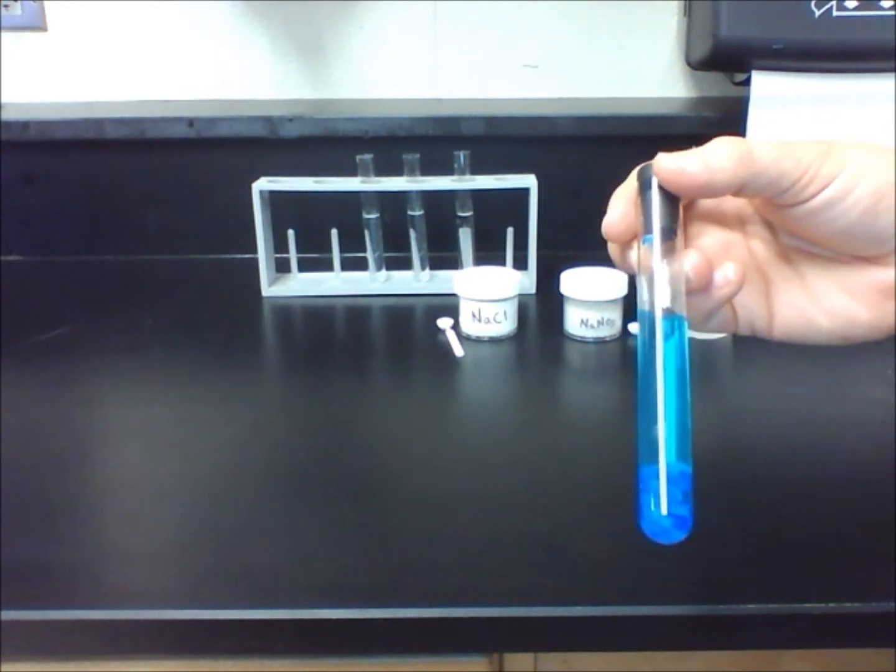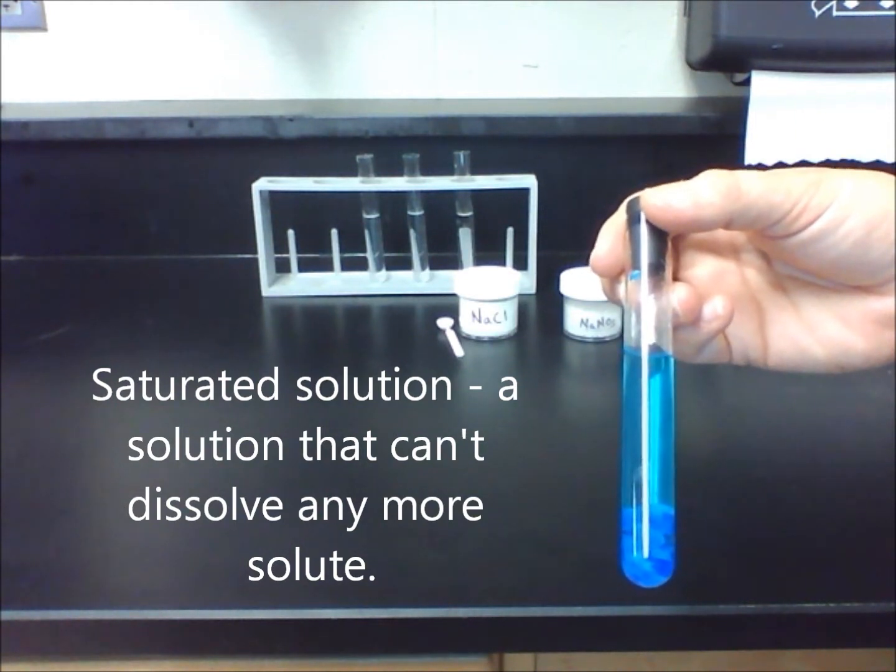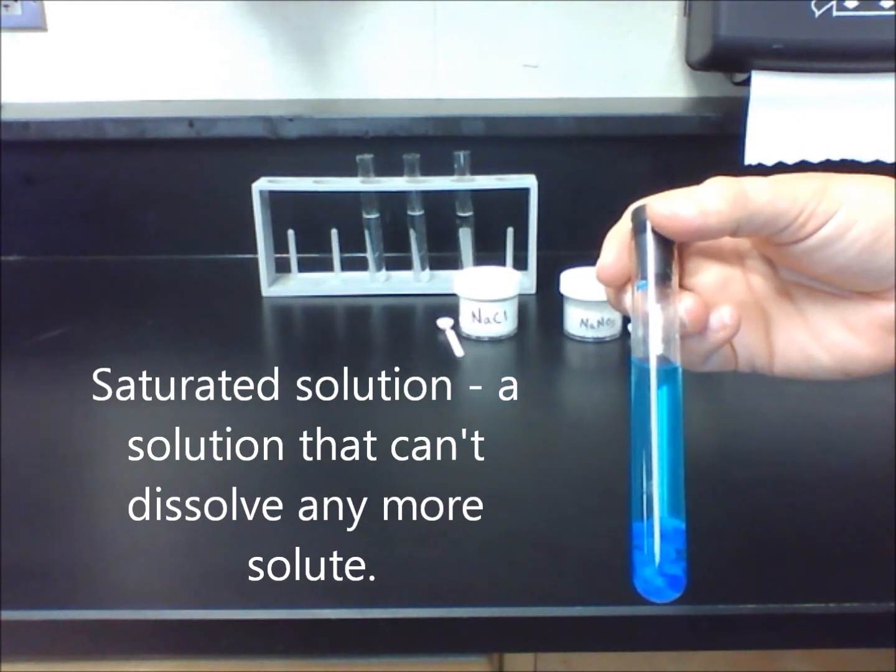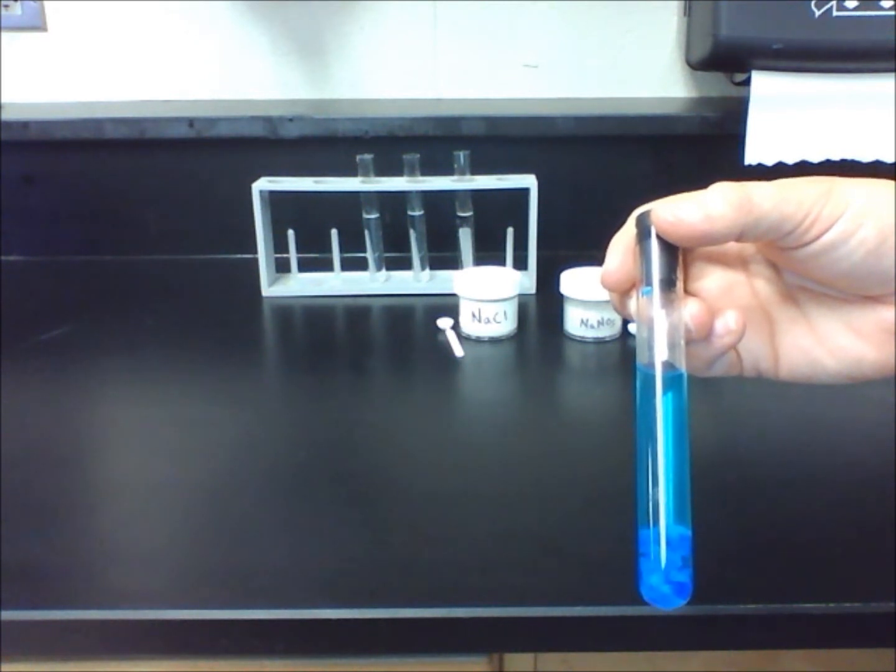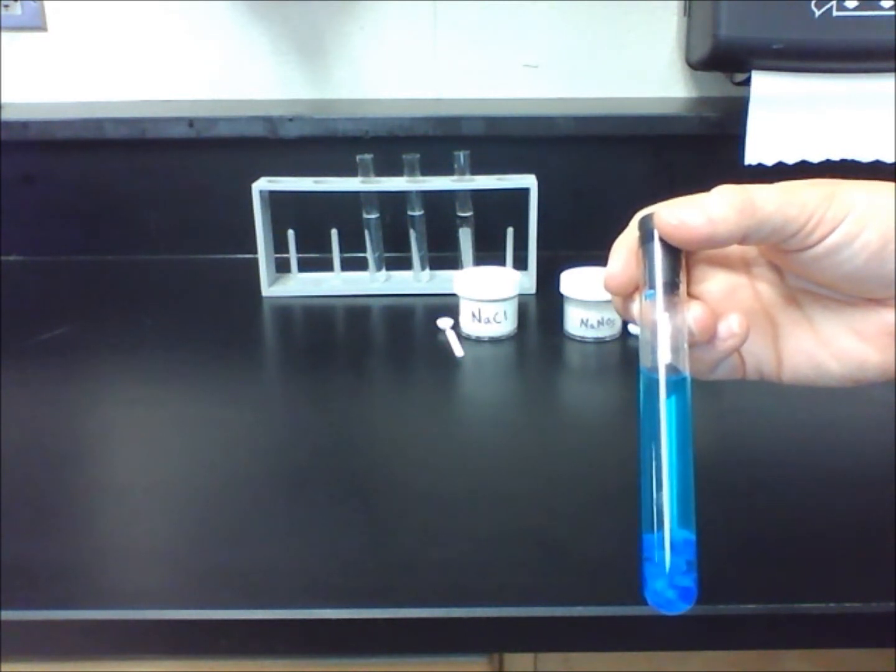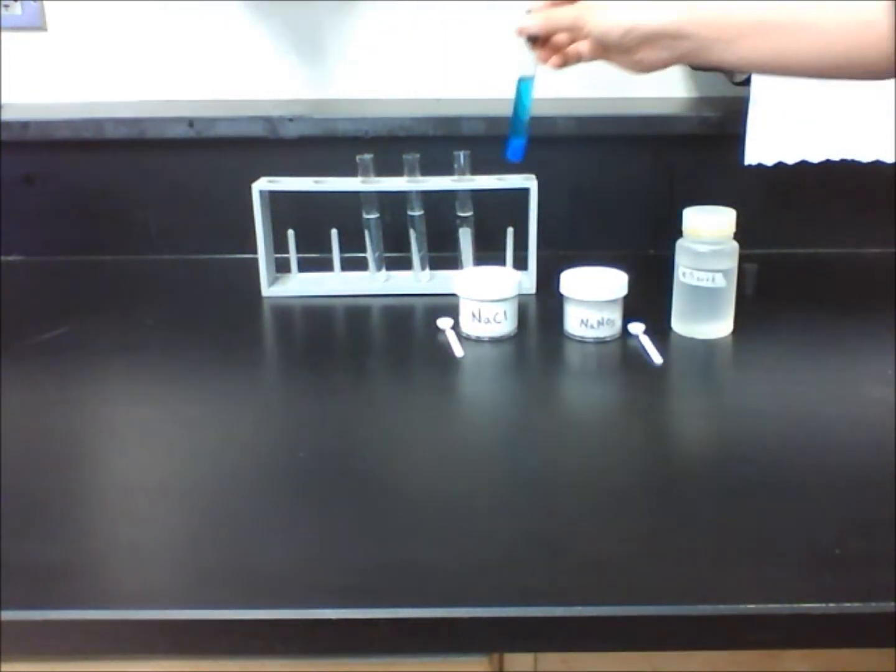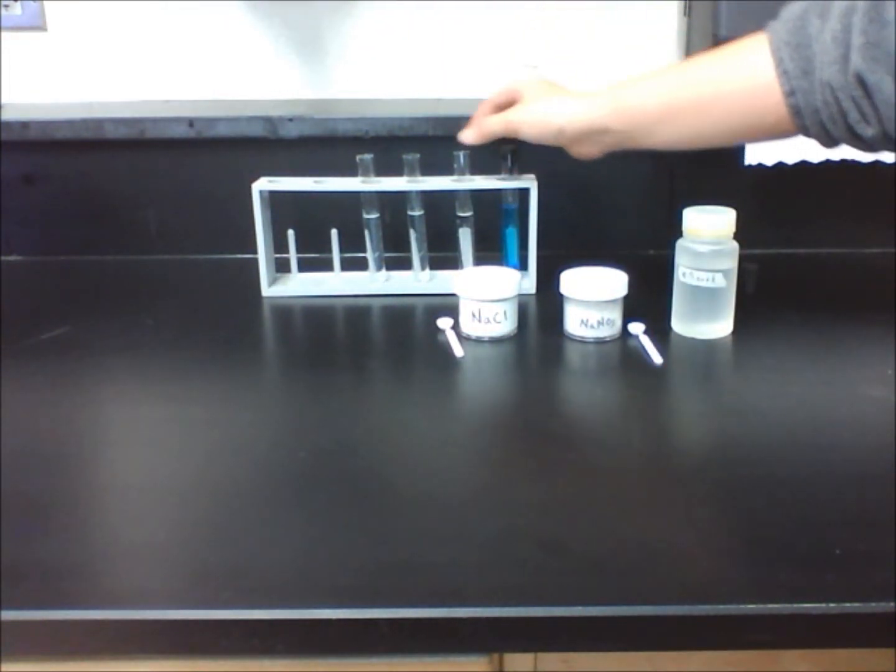The reason why there are undissolved crystals at the bottom of the tube is because the solution is saturated. We either need more water, more time, or more heat to dissolve the solute. Therefore, a saturated solution is a mixture in which the solvent can no longer dissolve the solute.